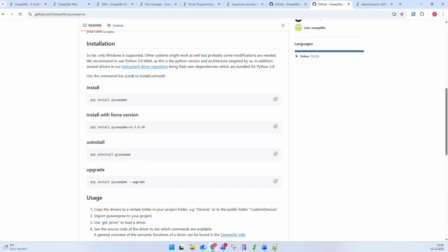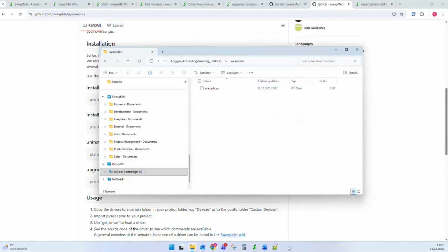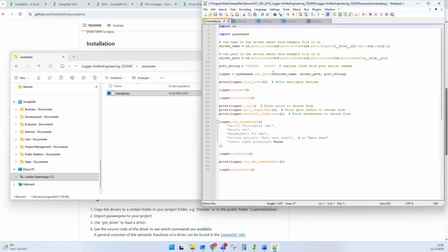I can show you once again a driver here from this transimpedance amplifier. It comes with an examples file. If I go into the examples file and move this file here into my notepad, you can see that we exactly use this getDriver function to load an instance of the driver. Beforehand, we defined the name and path and the port string. And now we can start using functions like find ports, connect, initialize, and so on. We can also use set parameters to override these user interface standard parameters, and then run functions like configure or TZA get measurement. Okay.